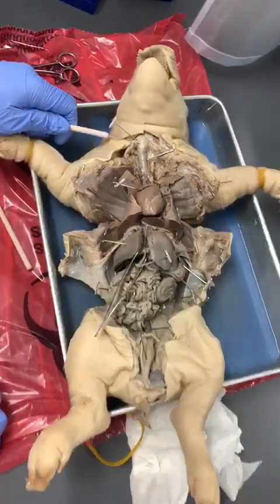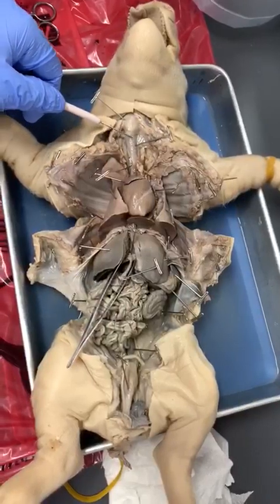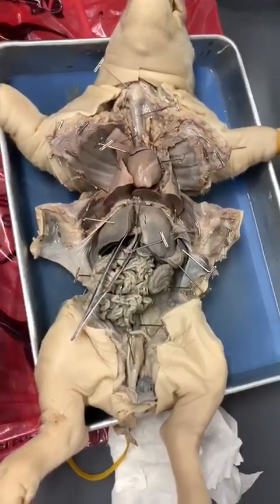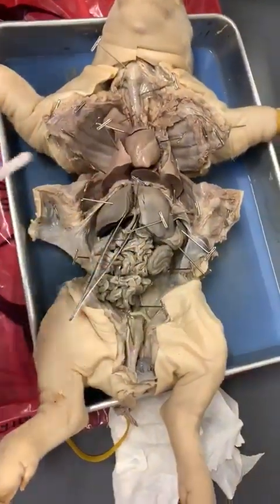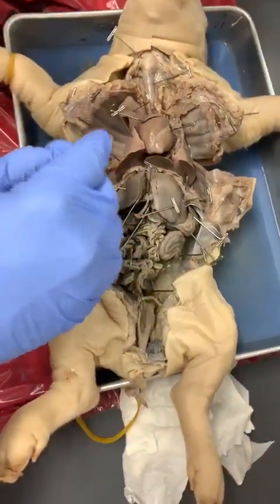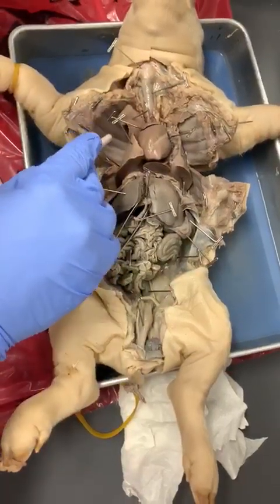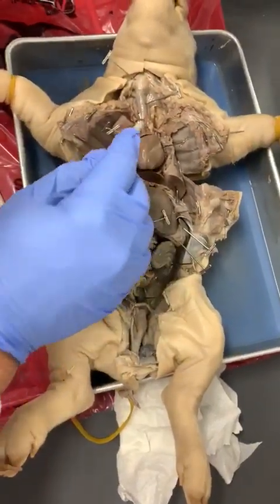Starting here, we have the larynx. This is the thyroid cartilage. Then we have the trachea. See the trachea rings? That's that pin 4. Then we have 1, 2, 3 lobes. So that's the right lung: inferior lobe, middle lobe, and superior lobe of the lungs. So you got 1, 2, and 3 pins.